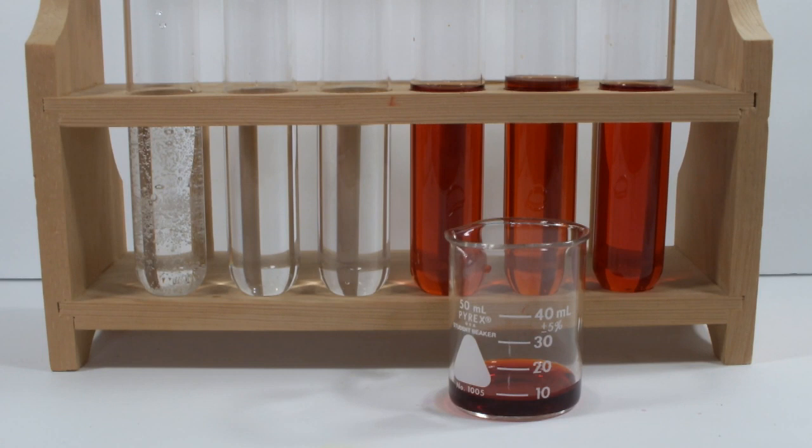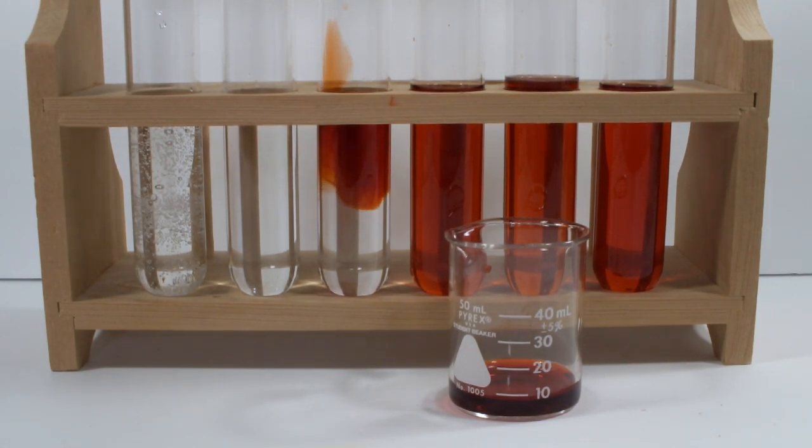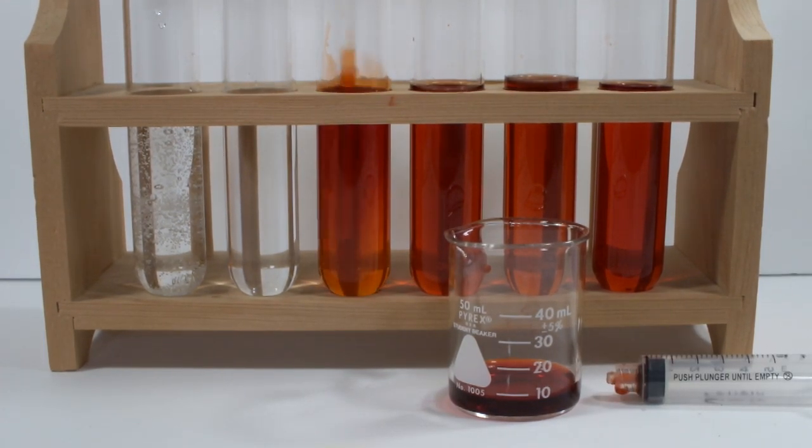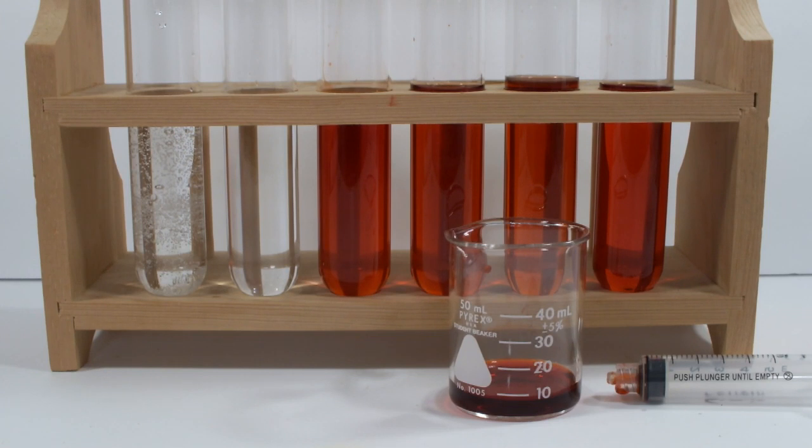The next tube contains an approximately one molar solution of magnesium nitrate. Nitrates are known to be oxidizers, and so why not? I chose magnesium rather than sodium or potassium because I figured there are two nitrates per mole rather than just one. But that's still not enough.